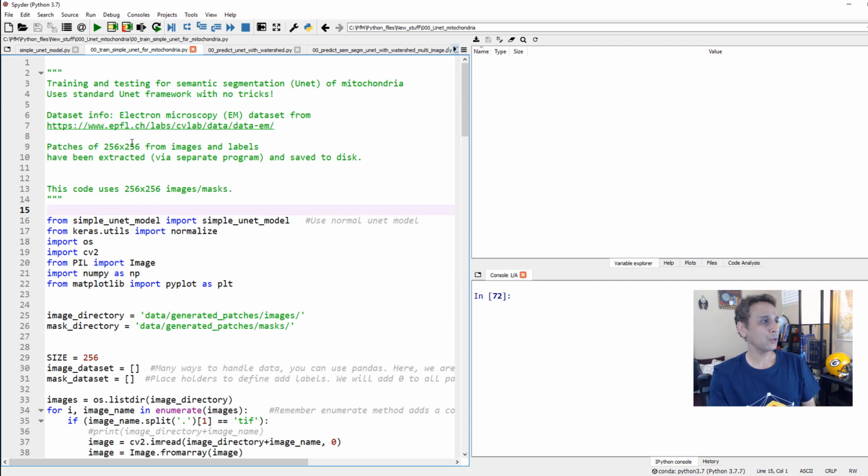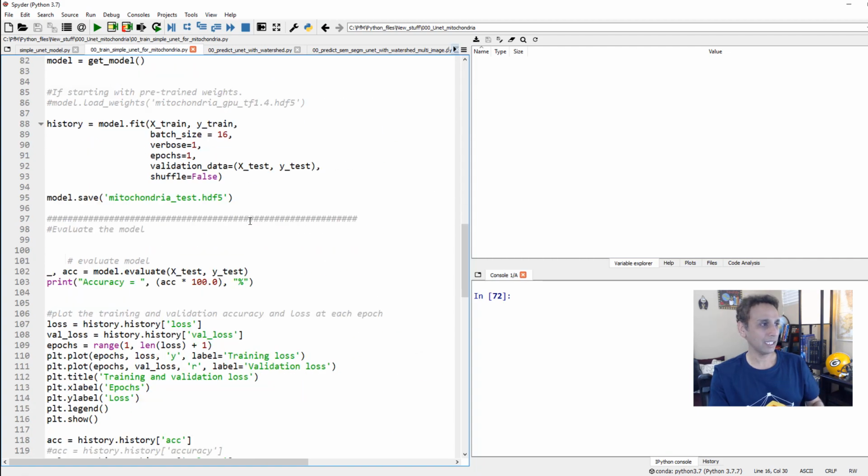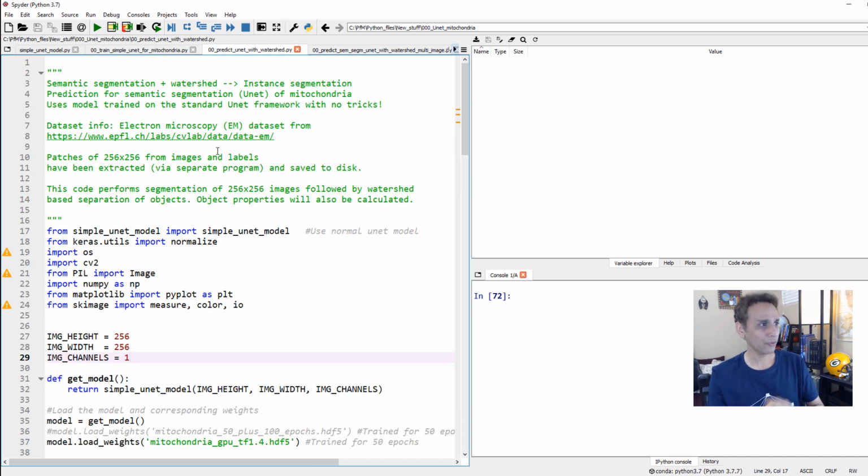And then we have used our simple U-Net model to train on these images and masks, and we saved it. I saved it as the file name mitochondria 50 plus 100 epochs. Well, I trained it for an initial 50, and then I was curious what happens if I do an additional 100. Nothing much happened, but this is what I saved. So now let's jump into the code for this video.